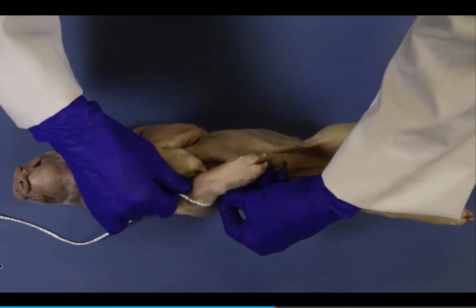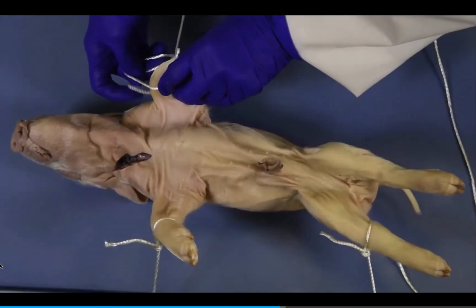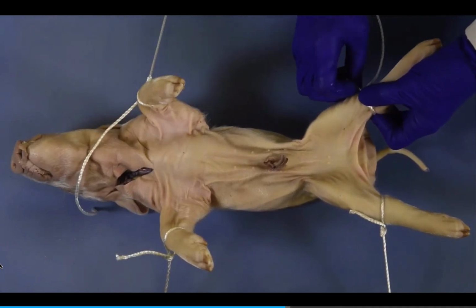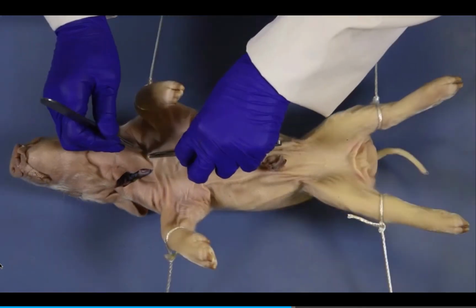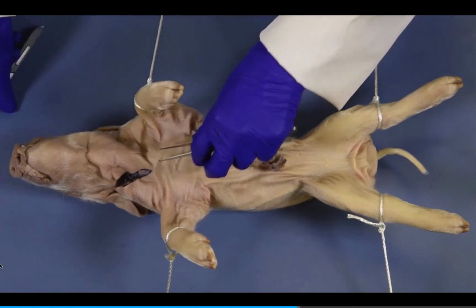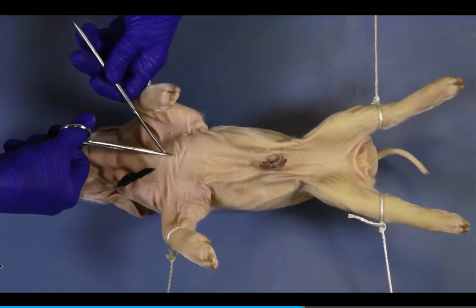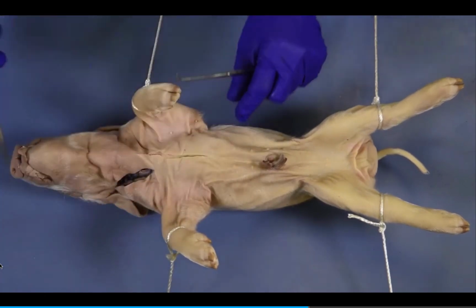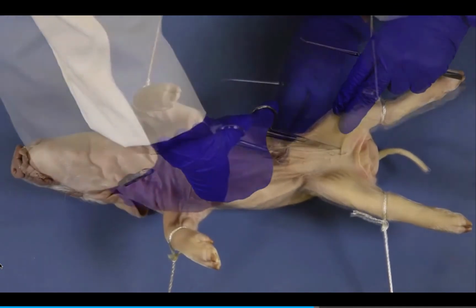First, secure the appendages by tying string to one forelimb and one hind limb, passing the strings under the dissection tray, and tying the strings to the other forelimb and hind limb. This will make it easier to make the proper incisions. Use the scalpel to make a short, shallow incision at the base of the neck. Now, use the scissors to cut through the skin to the top of the umbilical cord. Always point the scissors at an angle away from the underlying tissues as you cut. Cut around both sides of the umbilical cord and continue both parallel incisions toward the anus.